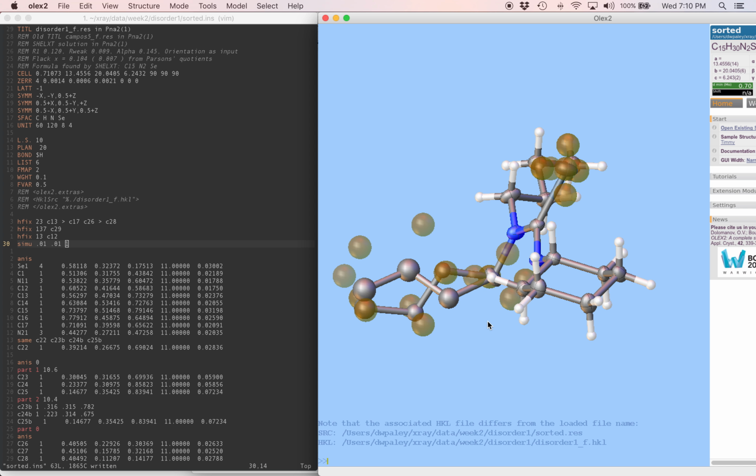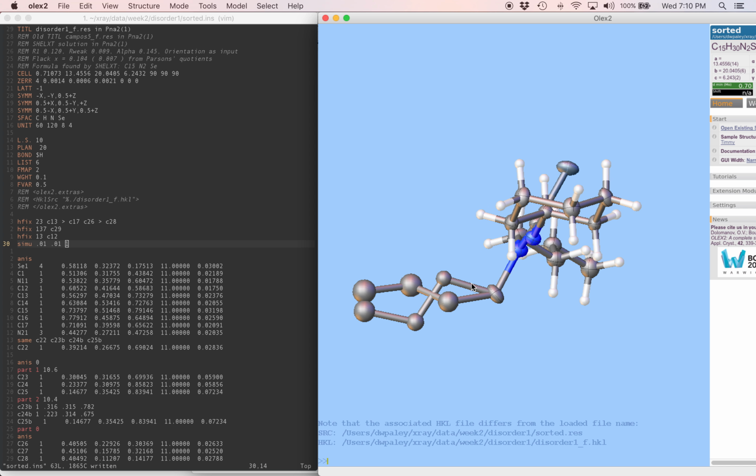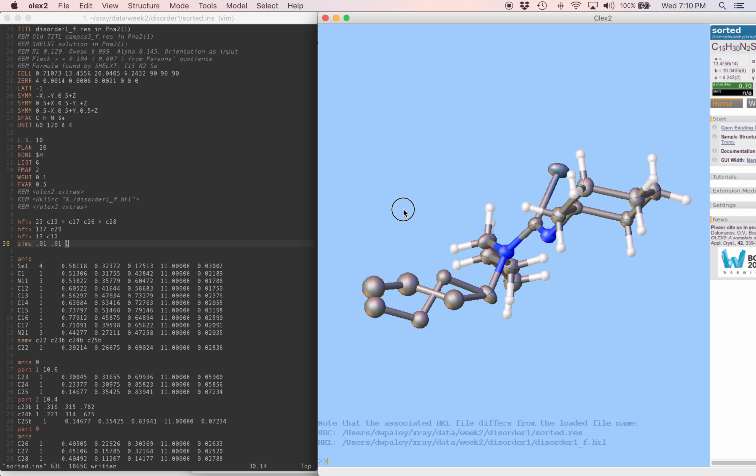Let's look at both together. We'll see if the geometry of the two parts is consistent. We'll check each of these bond lengths. We have a 1.59 and a 1.56 angstrom bond. 1.59 is a bit long, but maybe not so unusual. After that, we have a 1.49 and a 1.52, which are both fine. And 1.52, 54, those are totally normal.